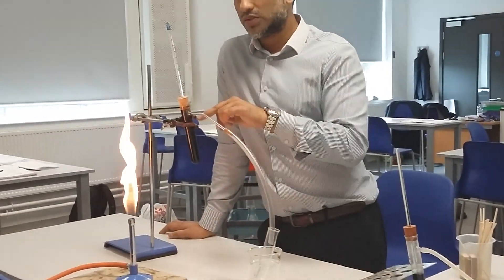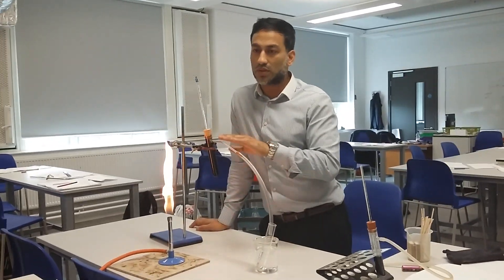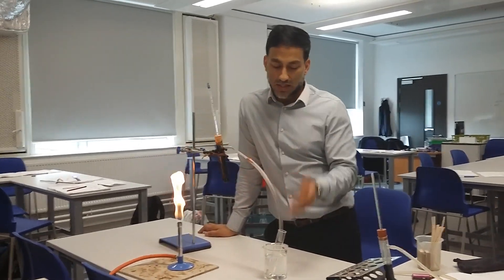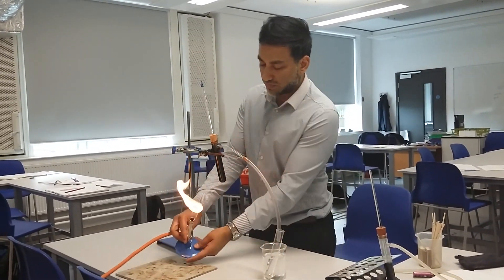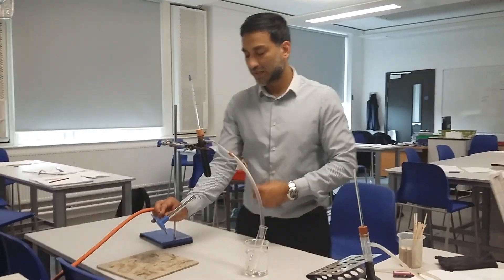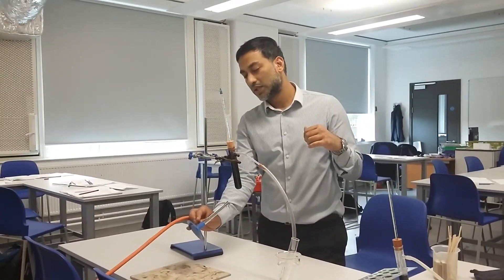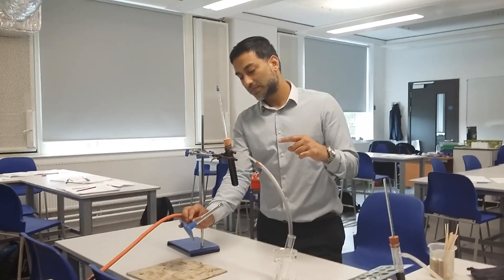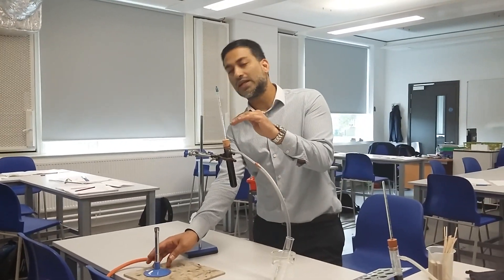So it's going to boil, and when the steam goes down it's going to become a liquid again when it condenses, and it will collect over here. What you're going to do is boil it at the right temperature — I'll give you the temperatures in a minute. When it reaches boiling point, just move the heat away to try and maintain that temperature.